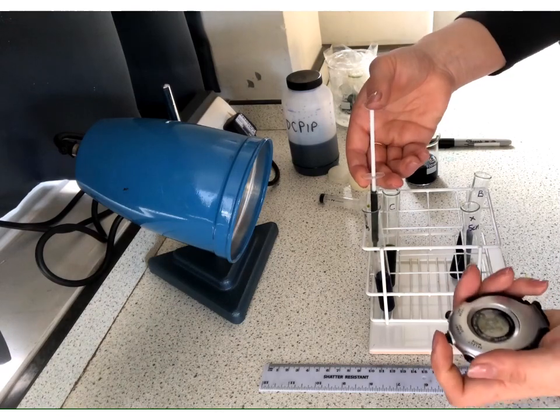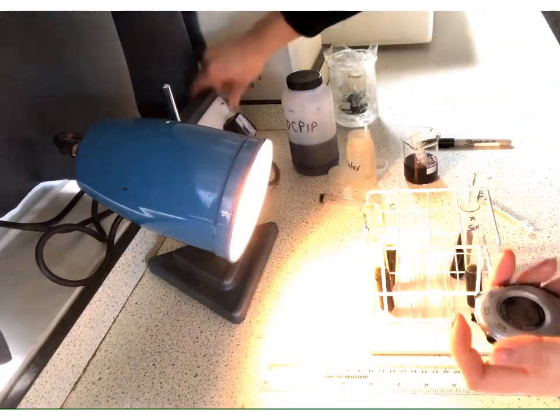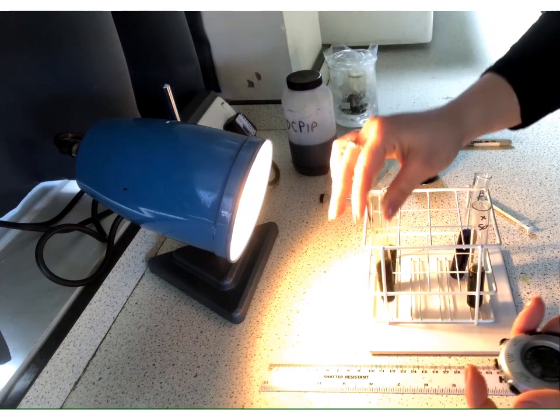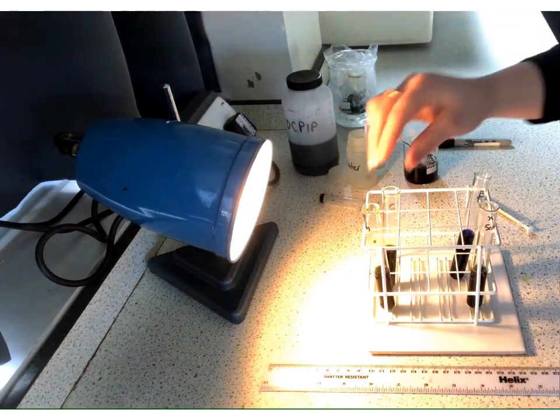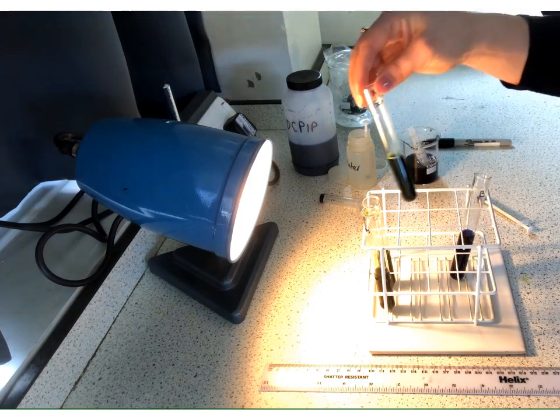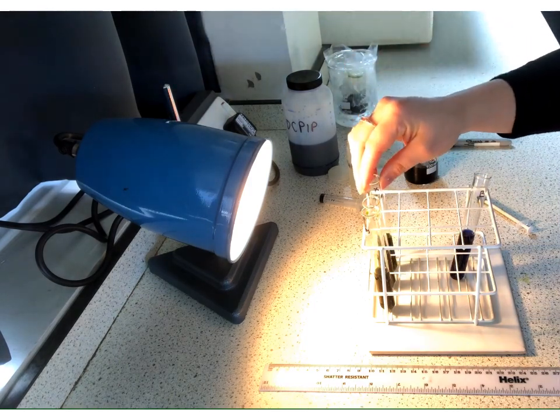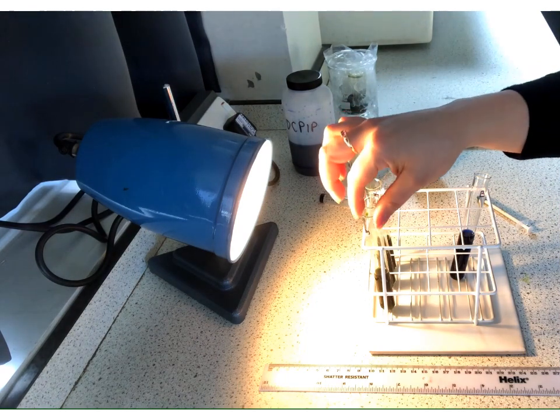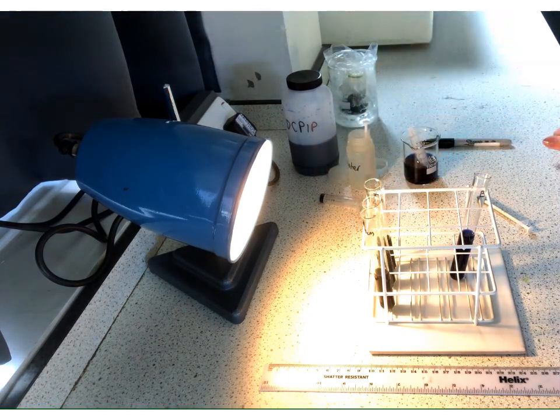Right. So we are in, start on. Little mix. I know that moved it slightly closer. All sorts of errors in this. Okay, so watching carefully for the colours to match. And in fairness, you could also compare it with that one as well. We're getting closer. Still got quite a bit of blue in here. What a difference 5 centimetres makes.